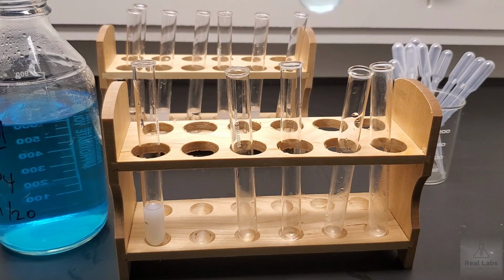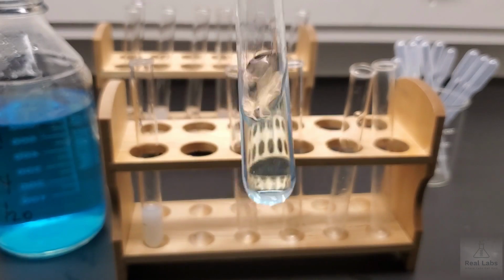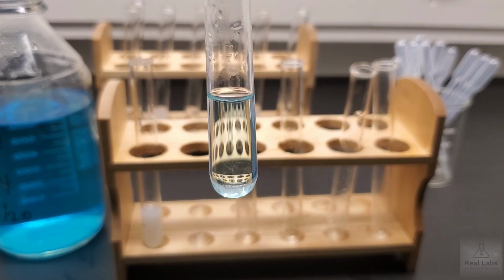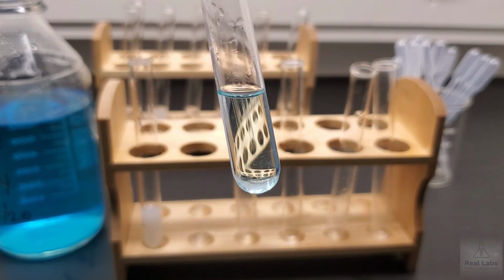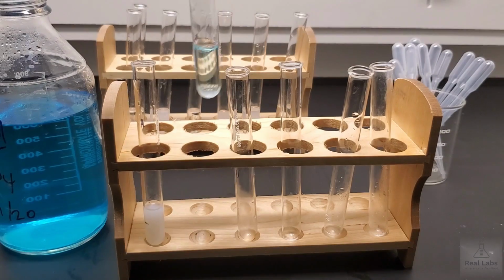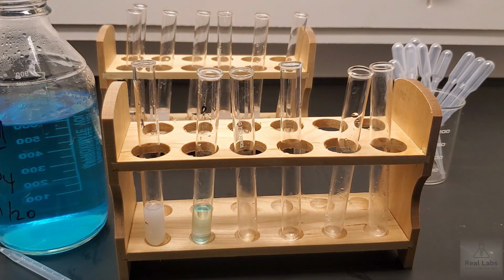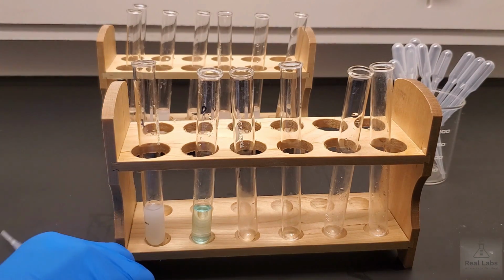So when we add the copper 2 sulfate to the ammonium chloride, we don't really see anything happening. A little shake just to make sure. No, we still get a very pale blue that is attributed to the copper 2 sulfate system, but other than that we don't really see any reaction occurring here. So that was the addition of ammonium chloride and copper 2 sulfate. Was number 9 in our reaction set.